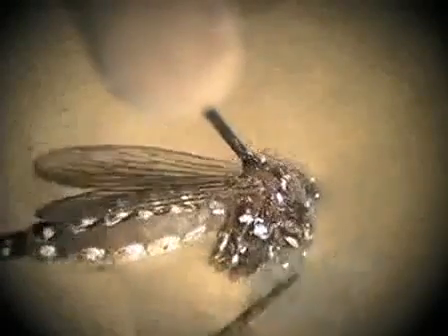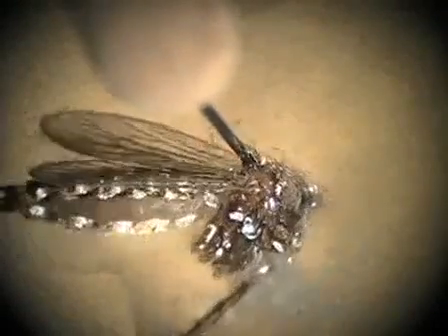My name is Judy Coleman and I'm part of the James Lab here at UCI, in the Department of Molecular Biology and Biochemistry. Today I'm going to be dissecting Aedes aegypti mosquitoes — specifically the salivary gland and the midgut. We are interested in these specific tissues because they are very involved in the pathway of the virus and the parasites.